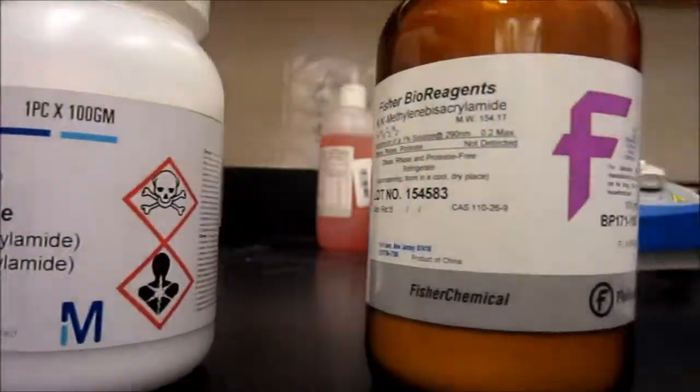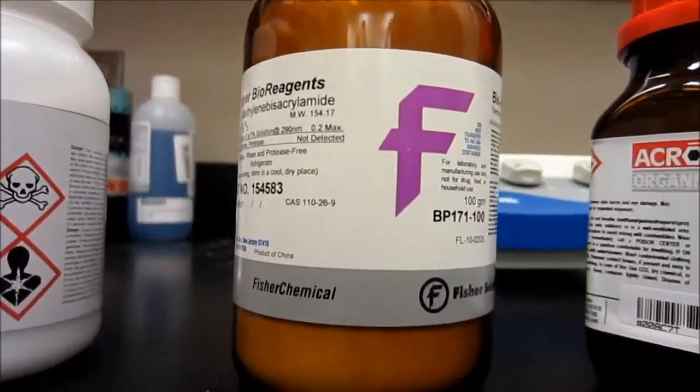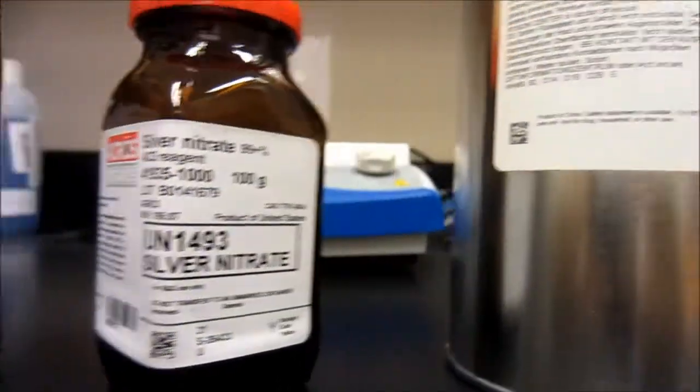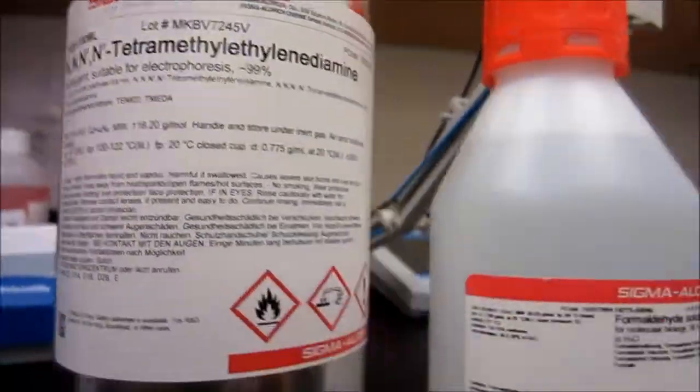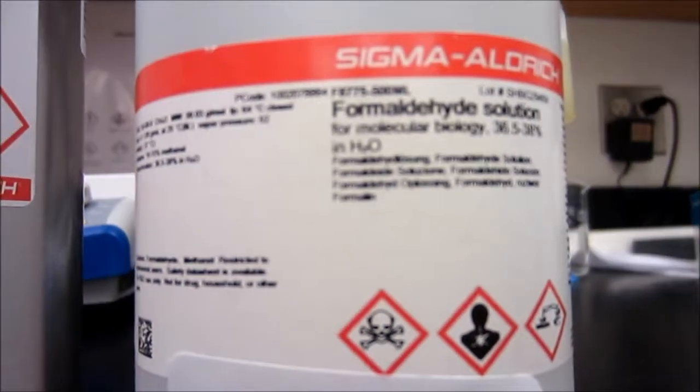The main chemicals used in PAGE are acrylamide, bisacrylamide, ammonium persulfate, TEMED, and 5x TBE buffer.